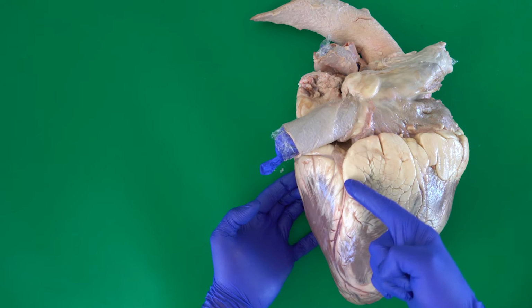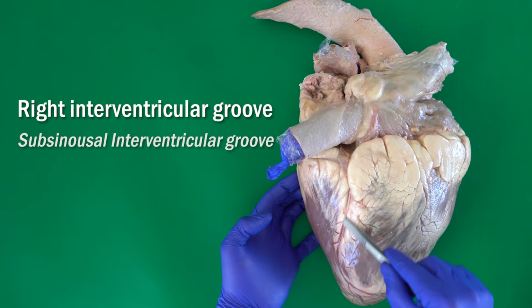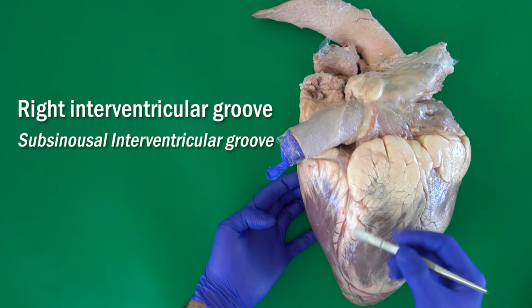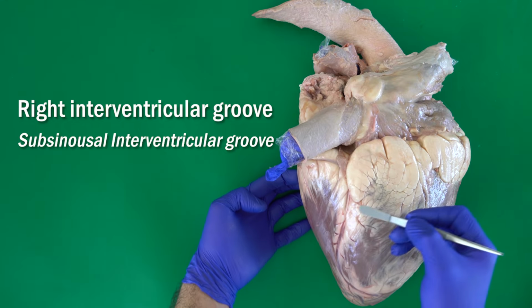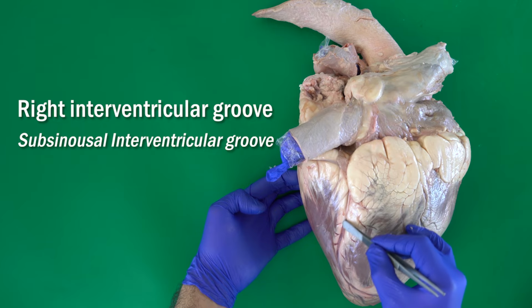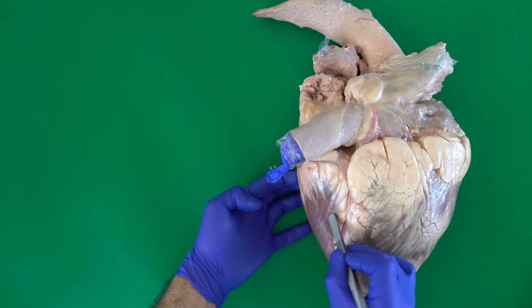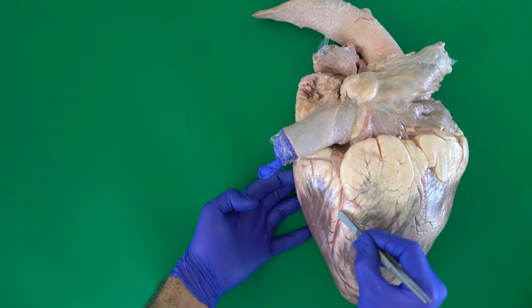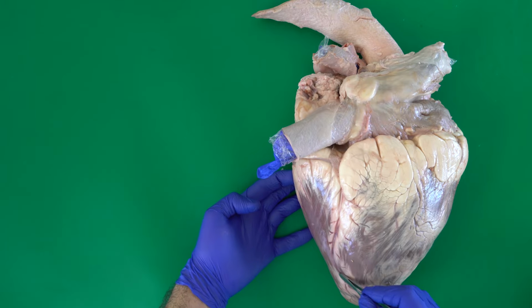Between them, there is another groove, called the subsinosal interventricular groove, or if you forget this name, just say the right interventricular groove, where we can see inside it again one artery and one vein. The artery is called also the subsinosal interventricular artery, which gives ventricular branches to the ventricles to supply them with blood. So, subsinosal interventricular artery inside the subsinosal interventricular groove.